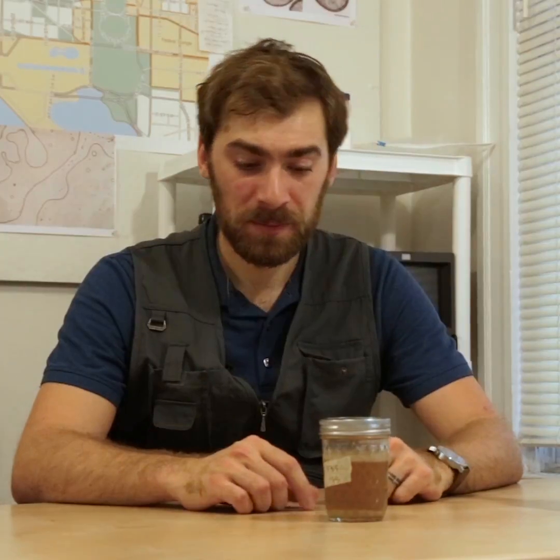Good morning. So, you've collected some wild yeast. You've seen some bubbles. You see some sludge at the bottom. You're curious — what have I got here? Is it beer? Is it safe to drink? In order to find out, we'll have to take a closer look.